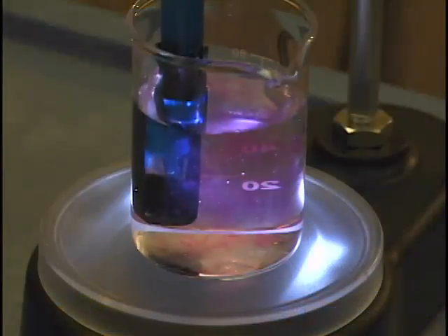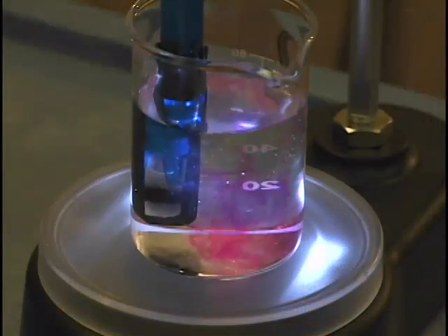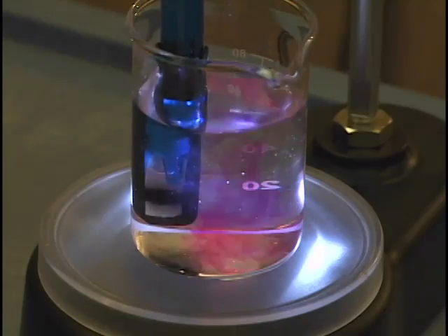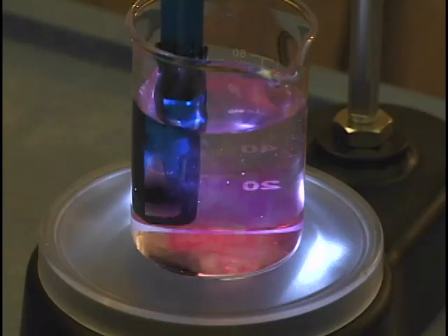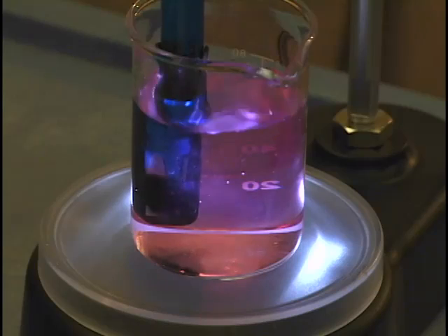I put some phenolphthalein in here and you can see as each drop goes in we're getting some pink lingering longer with each drop so we're really close to the equivalence point now. It looks like we are there.